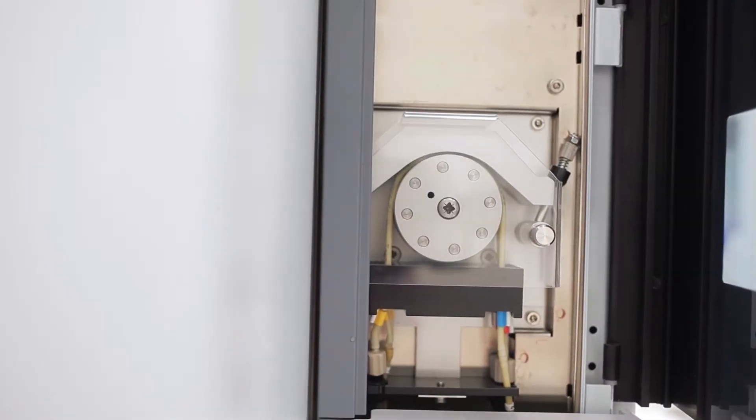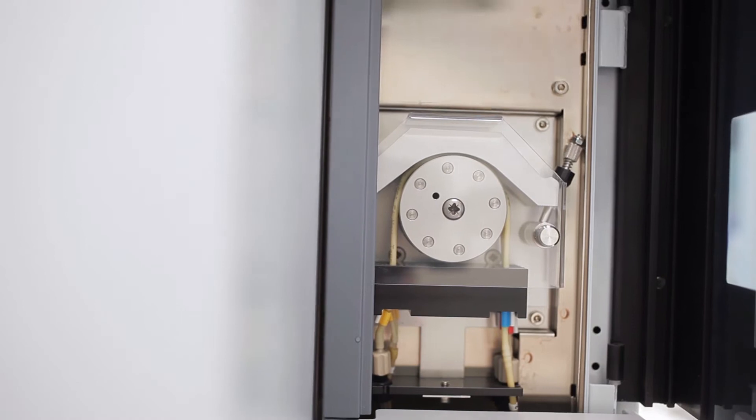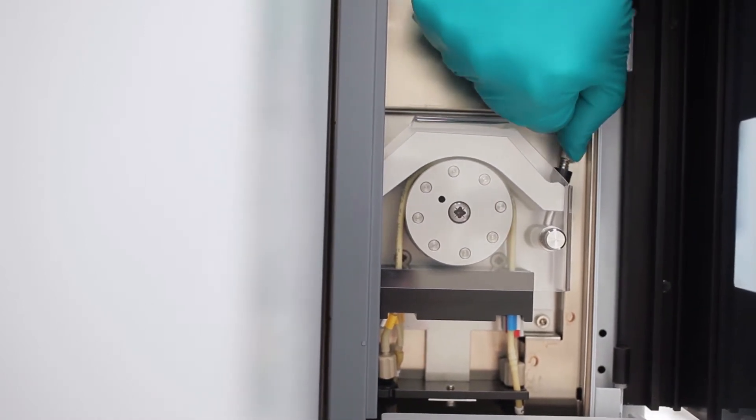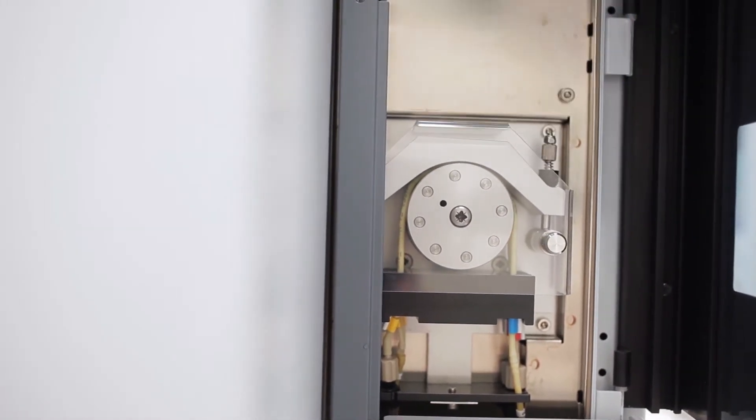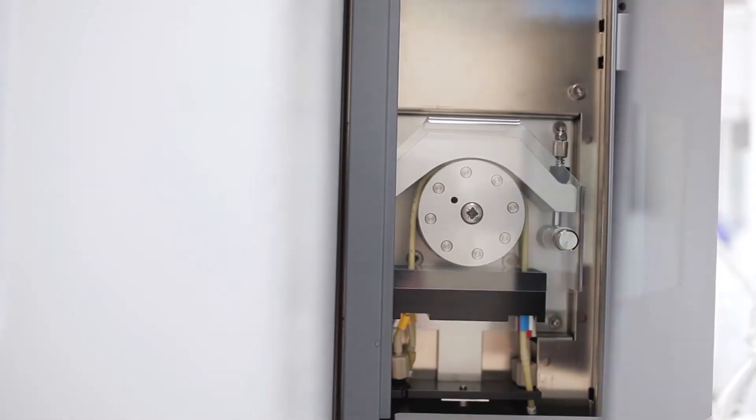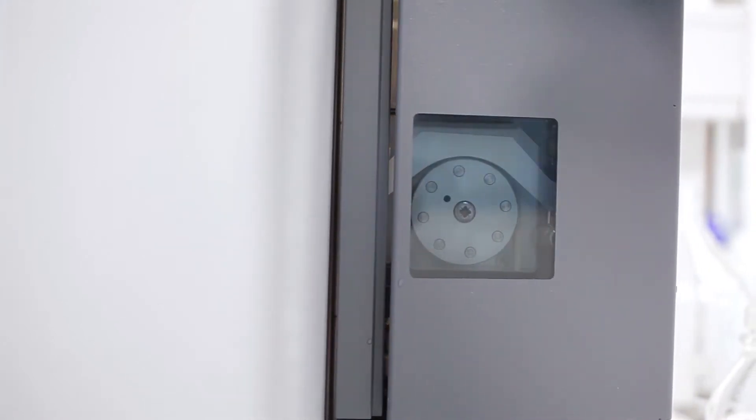Open the compartment on the right hand side of the instrument and check the peristaltic pump clamp is properly fastened and in the upright position.